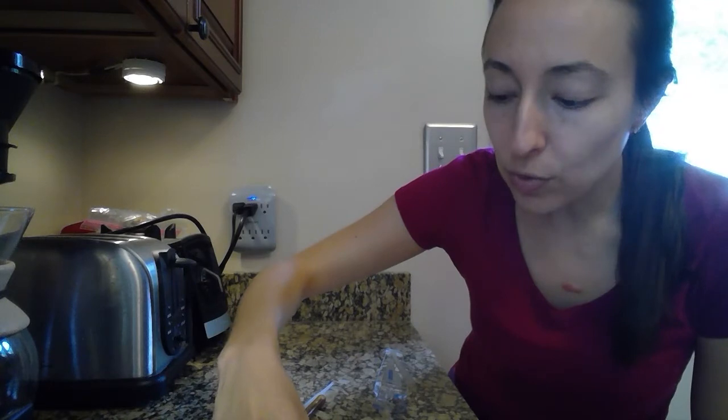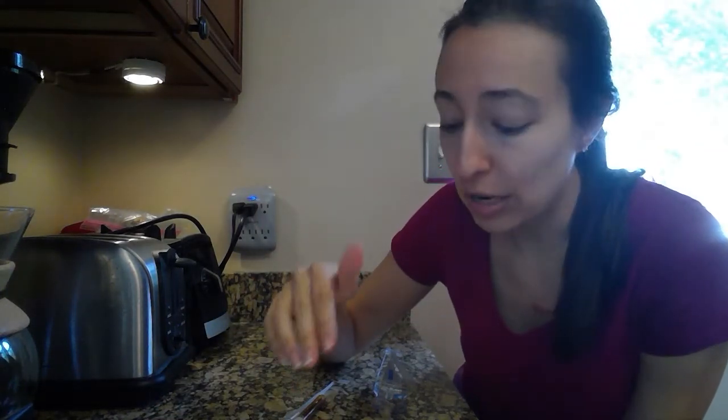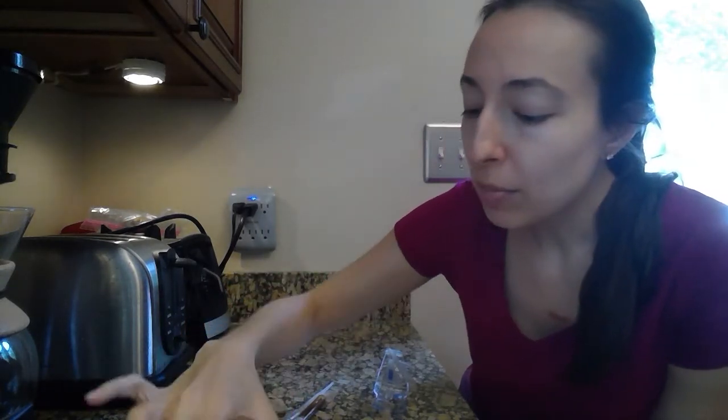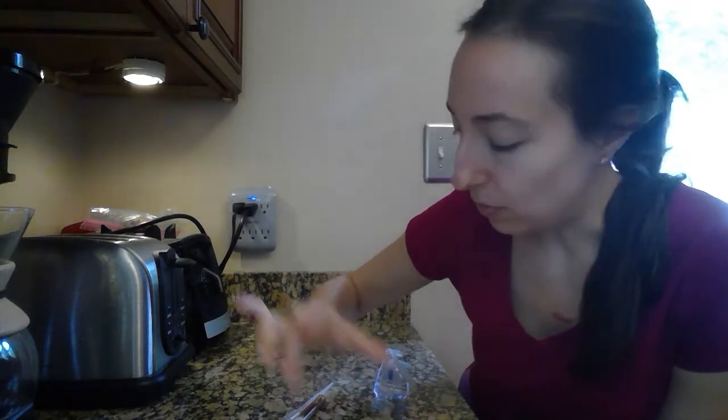You can pick 2 food items. Remember our categories above, so you want one to be in more of the grain category and one to be in more of the fruit and vegetable category. And then you can pick whatever you want for your 4th item, anything you're curious about, whether it's a food item or not. So go ahead and put those 4 petri dishes out if you have all 4.